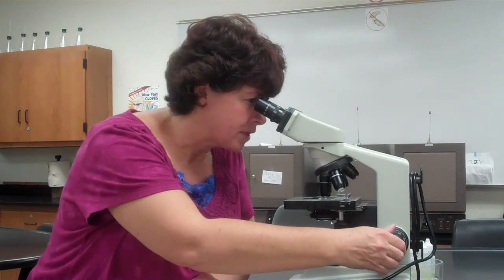I can now go to the 100. Now I don't go directly to the 100. You must use oil immersion. It is not an option. You may say, well, I can see it under the 100, which may be true. You'll see something blurry. Two things will occur. Either it will be the wrong color, or it will always be out of focus. You must use the oil immersion to decrease the refraction of light so that you get a clear, visible specimen and it is the right color.